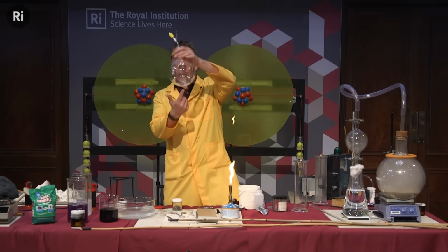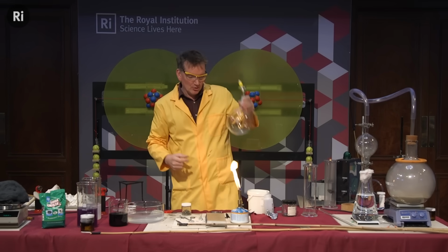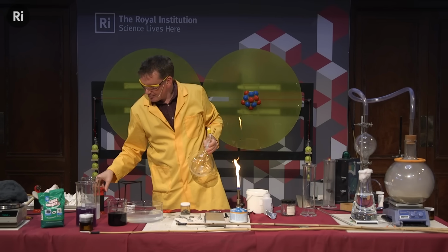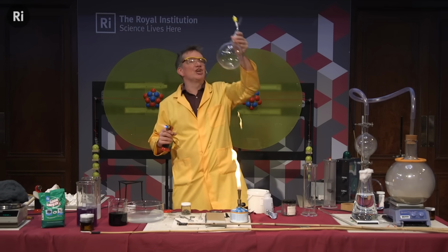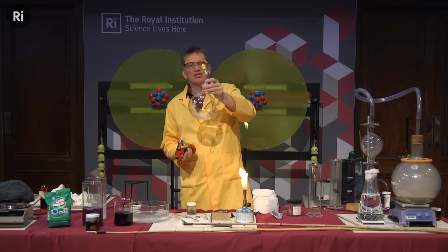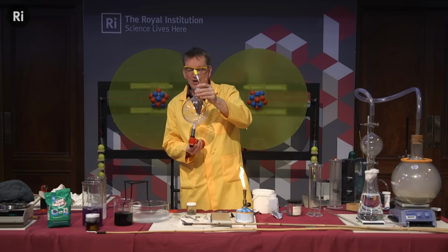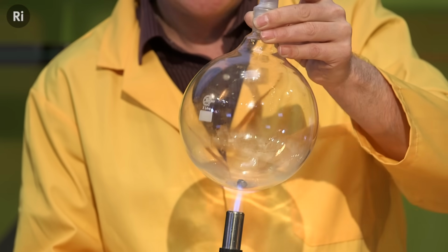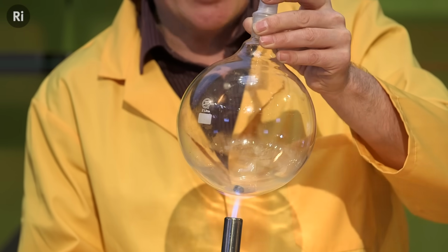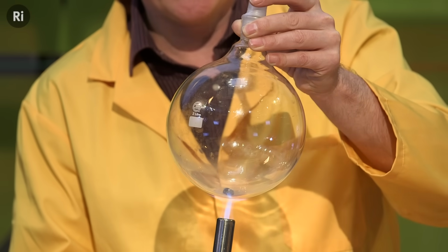Well, what I have here is lots of atoms of potassium. So this is a lump of potassium metal. And what I'm going to do is just heat up this lump. Now, there's no oxygen in my flask to react with the potassium. So we've completely evacuated the flask. So it's empty apart from the lump of potassium at the bottom. But I'm hoping that we should be able to see a reaction when, just warming this, I'm hoping that it should be quite easy to separate the atoms of potassium. So this is what I'm trying to do.